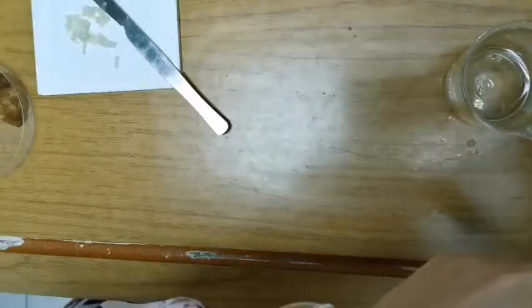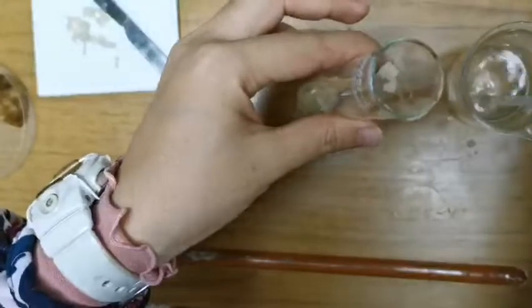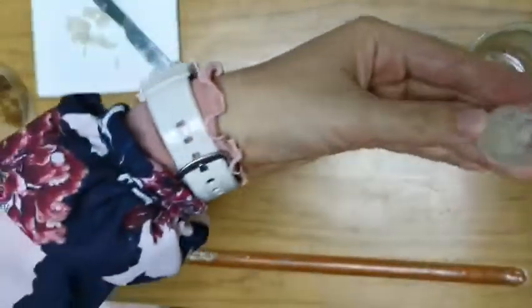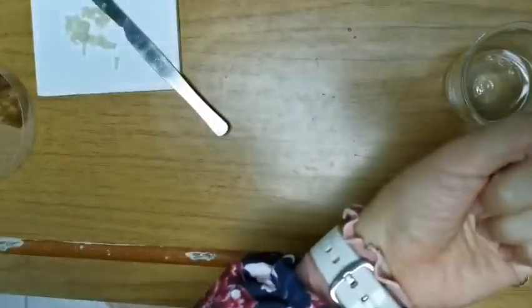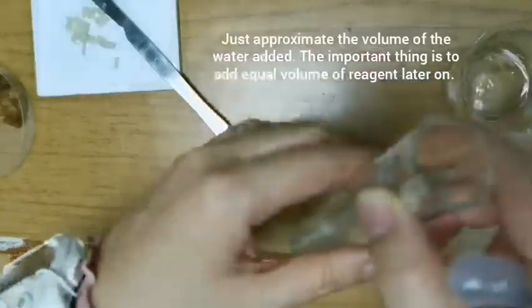So you can adjust how much water is in your pipette before you squeeze it in. If you don't think this is enough, this is about 2 cm. You can just approximate. So I'm going to take maybe one fingertip volume of water. I'll add that in.